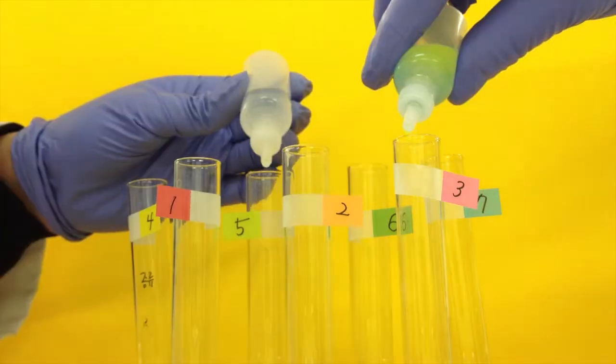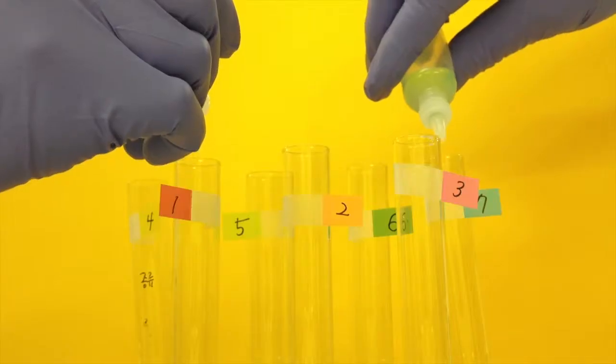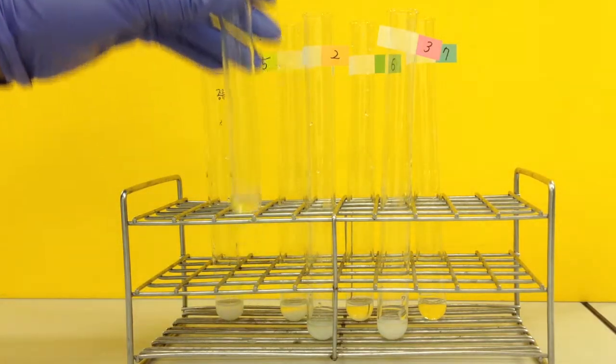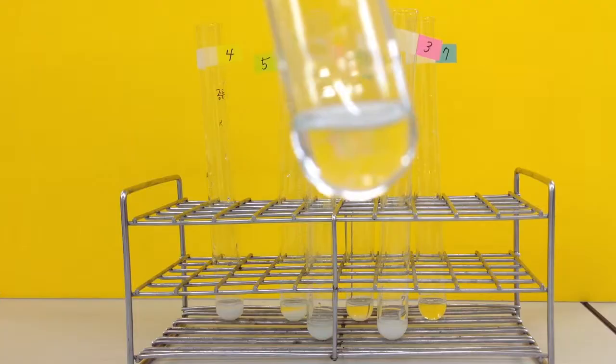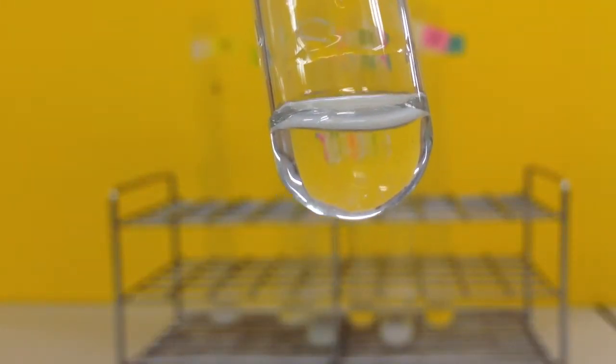The one that produces the most product will have the ratio of A and B that best matches the ratio that they react together in to form the new compound. The chemicals we used in this lab react to form a product that will precipitate, that is, fall out of solution, like snow or rain precipitate from clouds.